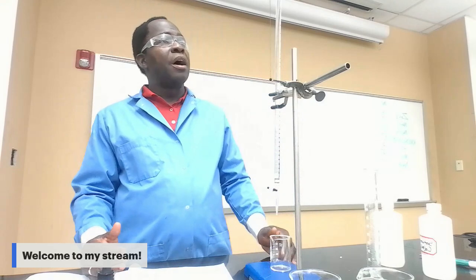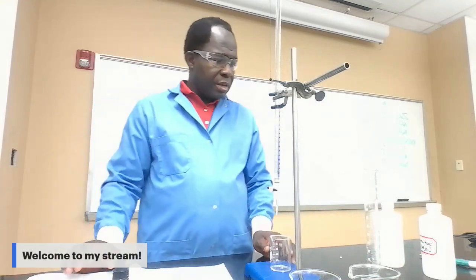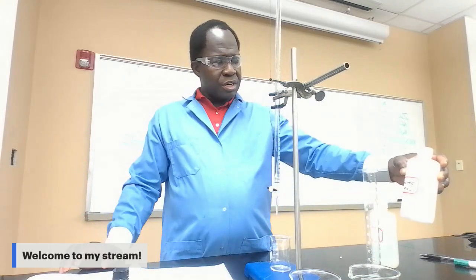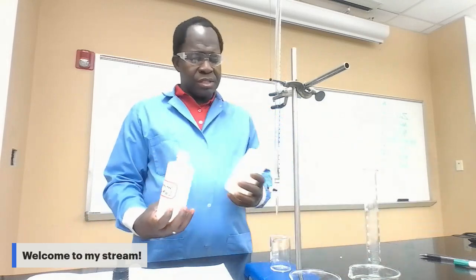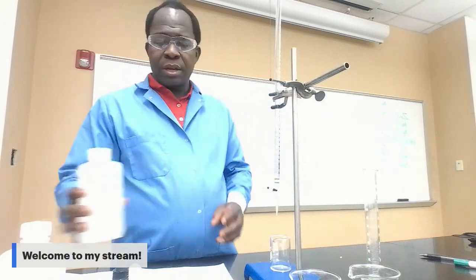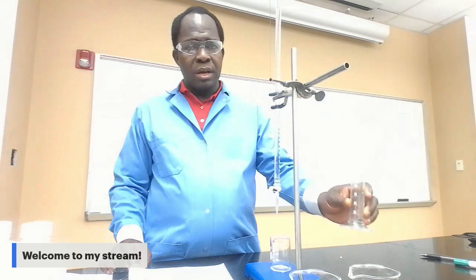Okay, so before we move to the titration part of the lab, you need a stand and a clamp that will hold the burette. You need three 250 milliliter beakers and phenolphthalein. You need a saturated solution of calcium hydroxide, which I have here, and you also need 0.05 molar hydrochloric acid. Other than that, you also need a 100 milliliter graduated cylinder.